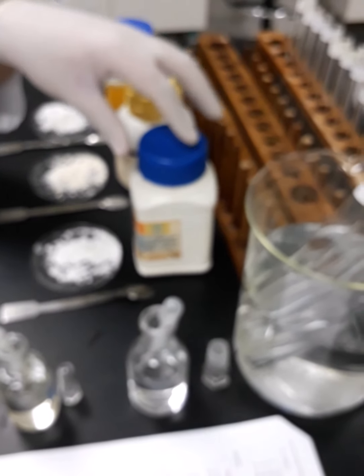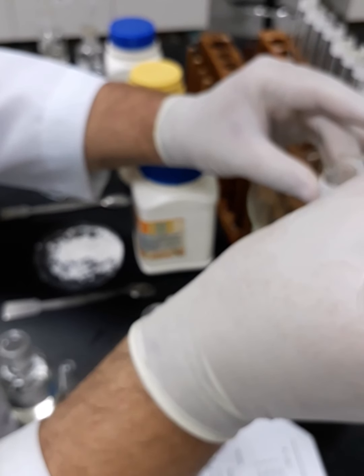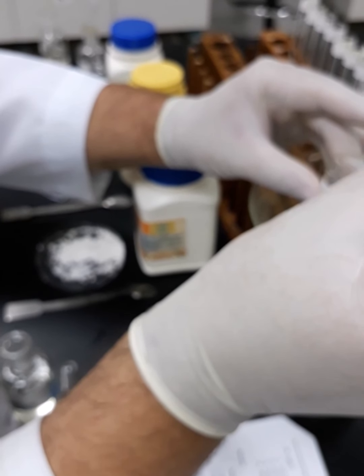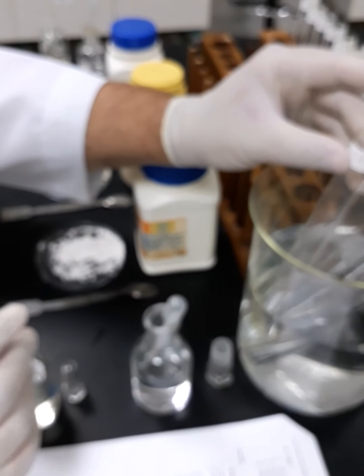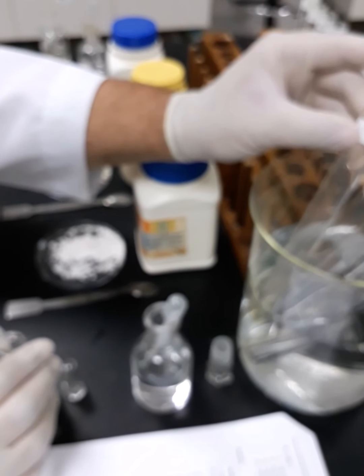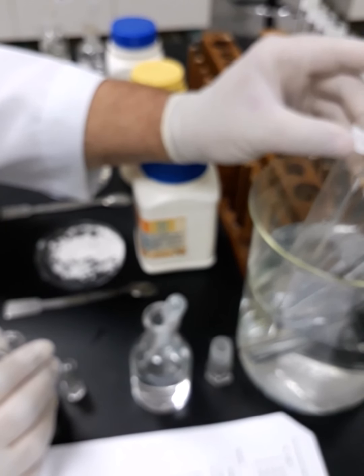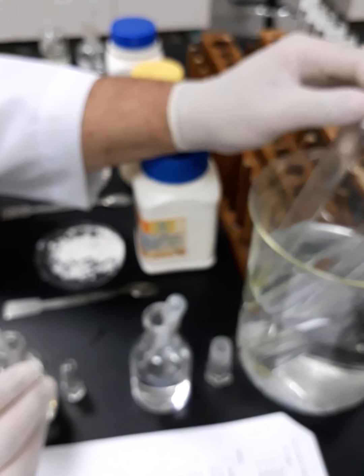Now we are going to proceed with the second sample, which is para-aminobenzoic acid, and we will find out if there is bubbling or gas evolved. Of course, this gas evolved, it is nitrogen. Now here we are going to do that. 4 and 5. Okay. Yeah, there is only few bubbles there, but it is not as much as in case of tyrosine. Even tyrosine, till now I can't see bubbling.